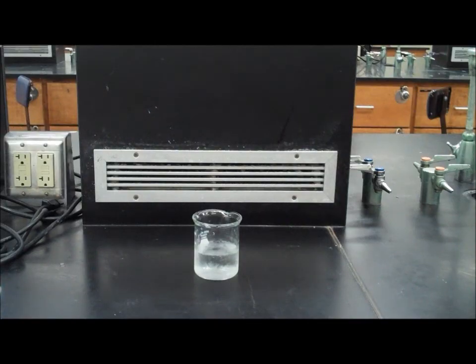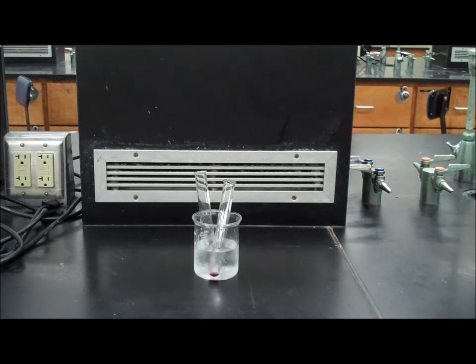Create an ice water bath by filling the beaker with ice and a little bit of water. Place one permanganate solution and one oxalic acid solution in the ice water bath for five minutes.